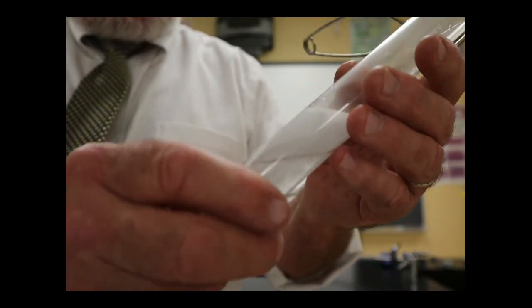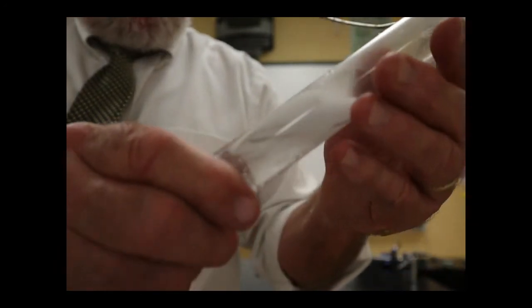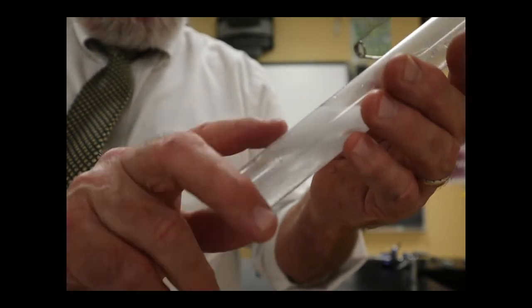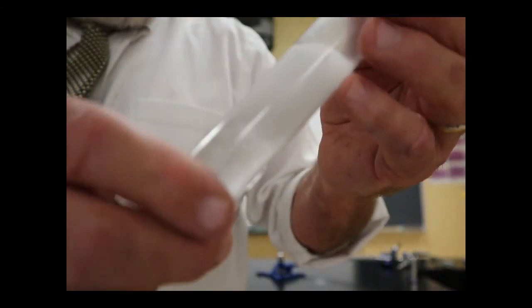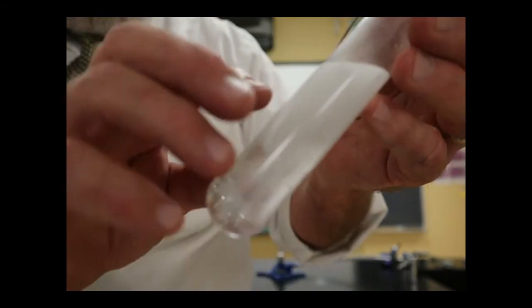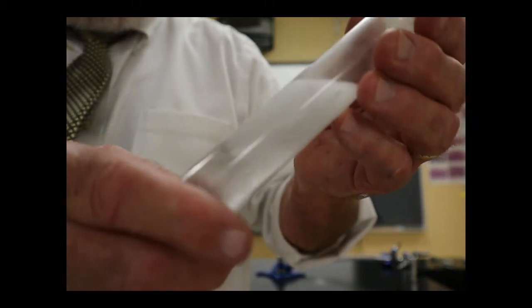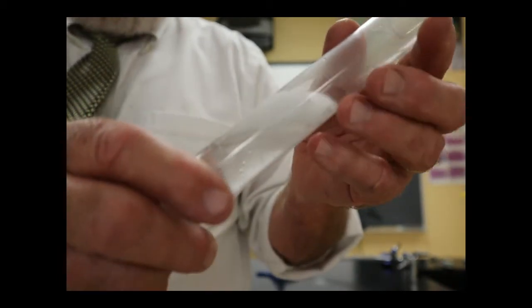It's going a lot slower than I had hoped. I could have used a more concentrated acid. And maybe if I wanted to do this a little quicker, I would want to use a more concentrated acid next time. All right. This one is fairly dilute, which means in 1 liter of this acid, there'd be 1 mole of the acid. And maybe I should have used something with like 3 moles of acid, because the more acid you have there, the faster it's going to react.